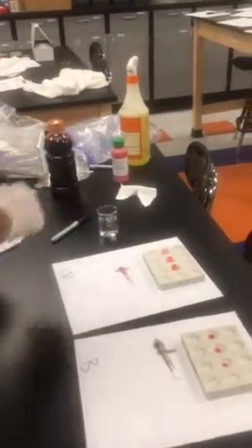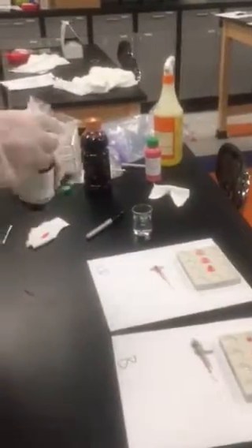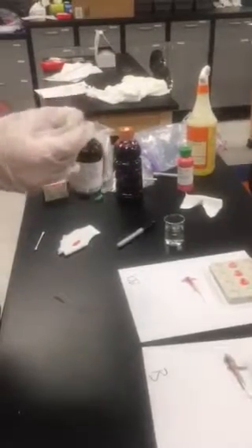So if you come in a little closer, I have two samples here. These are samples of something that's not blood. This is blood. And so the first test we're going to do, and I'm going to have you do in the lab, is a Kastle-Meyer presumptive blood test, and that's using what's known as a Kastle-Meyer reagent.